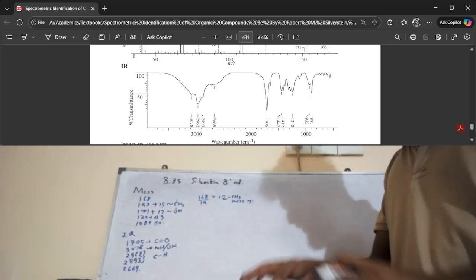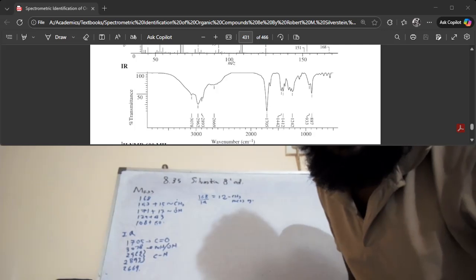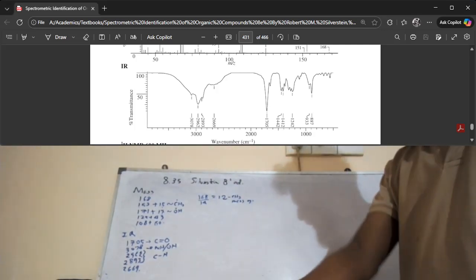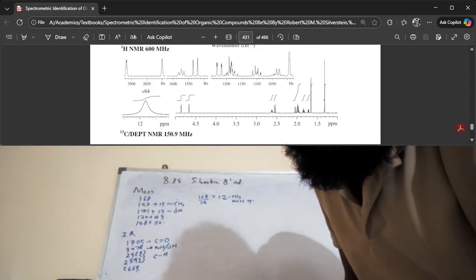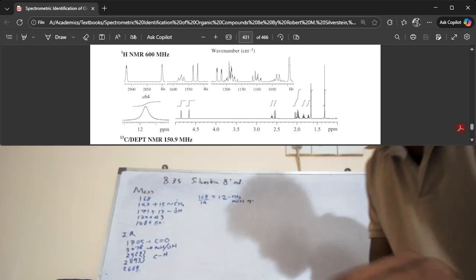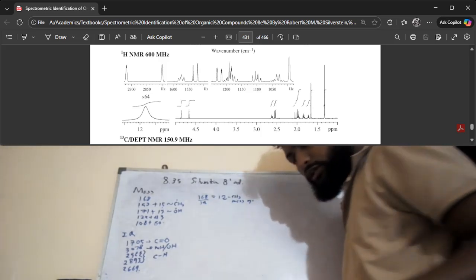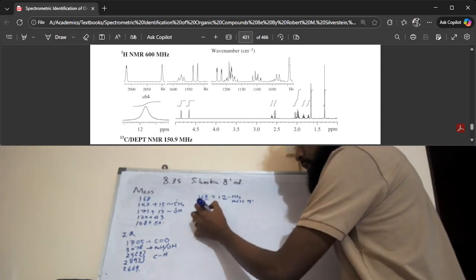Then let's get on to the HNMR spectrum. I've extracted the data on my piece of paper, but we'll also go about it in this way. As you can see, there is the HNMR. This is how I put the data in my table. So this is the 1H NMR.